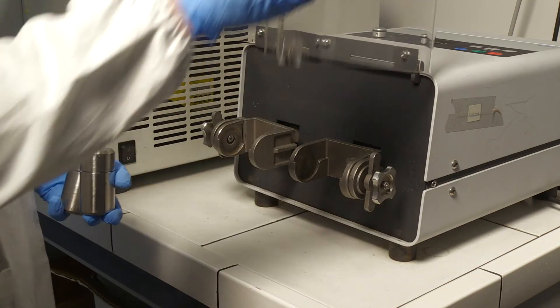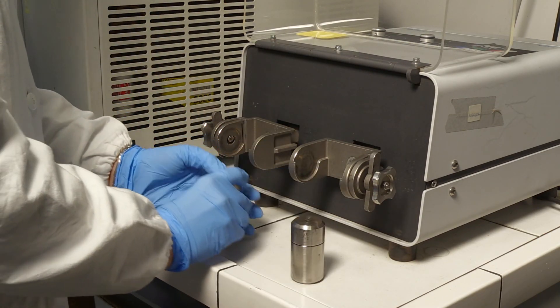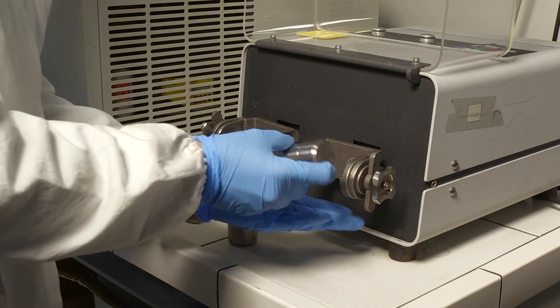The jars must be firmly clamped into a mixer mill set to a frequency of about 20 Hz for 15 minutes.